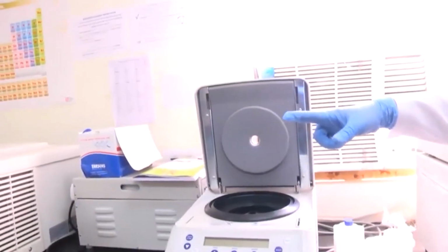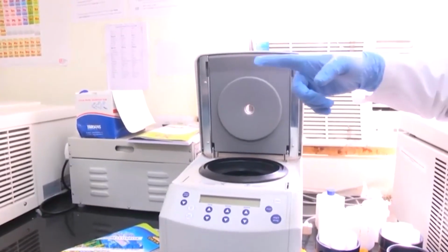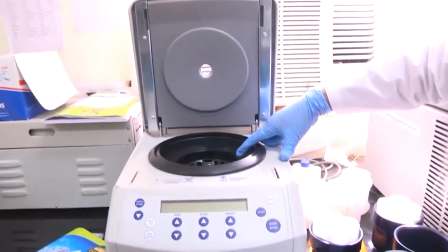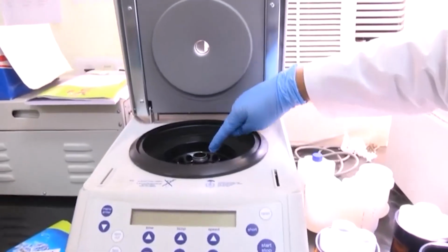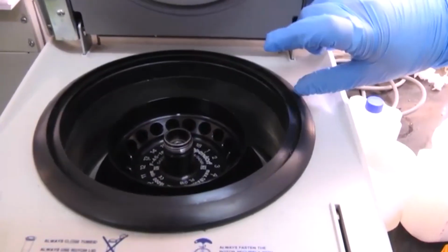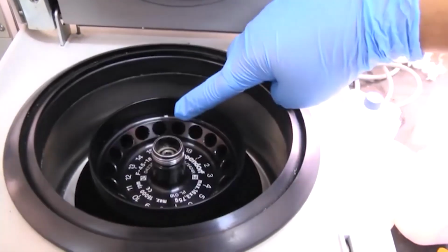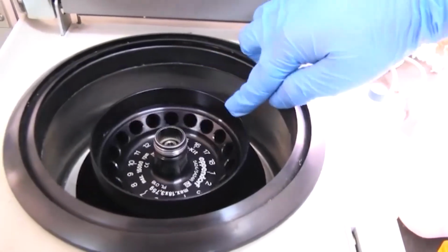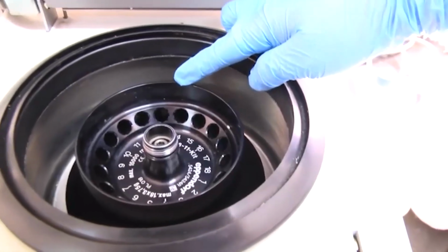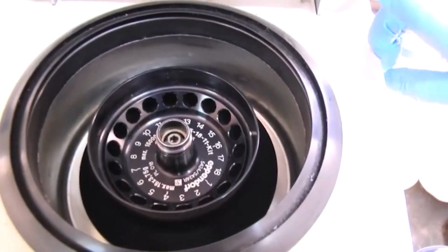So, the earlier centrifuge that I showed you had a swing out bucket. I could not show it to you because the machine was running, but here what you can see in this centrifuge is it has a fixed angle rotor. So, as you can see these small holes, inside these holes we can place small Eppendorf tubes, and right now the machine is switched off, but what will happen is once I put the centrifuge tubes here, the machine rotates, and as you can see the centrifuge tube which has been placed here or which will be placed here will always remain at a constant angle.